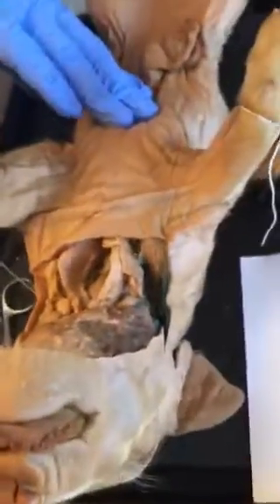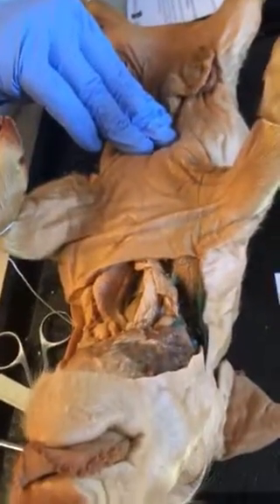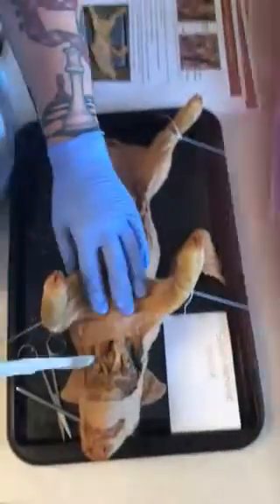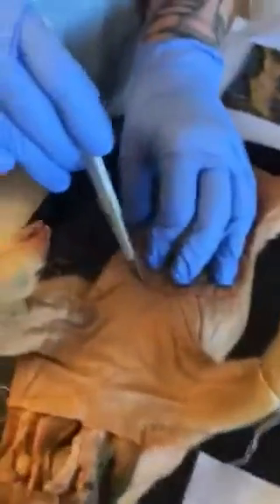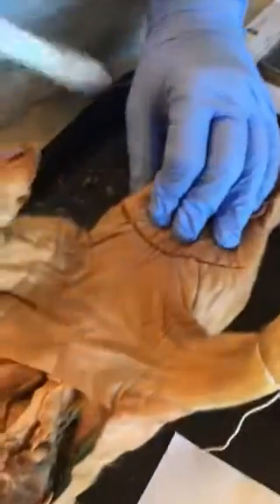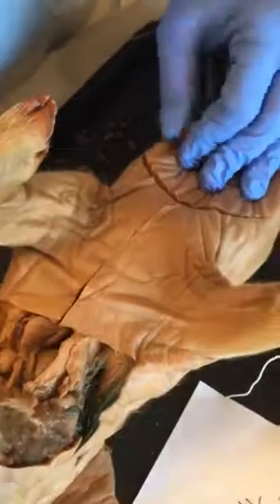Figure 13. Make incision 1 as shown on figure 13 by using the scalpel to cut through the midline of the chest muscles. Start at the most superior portion. So, this part is already open, so we're gonna go here. This is where our lower incision will be. This is how the diagram is showing it. And then straight up here, okay?